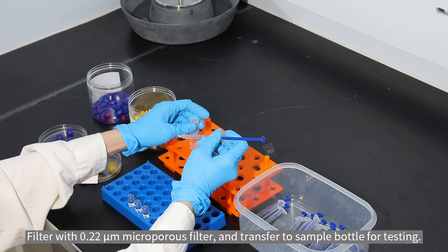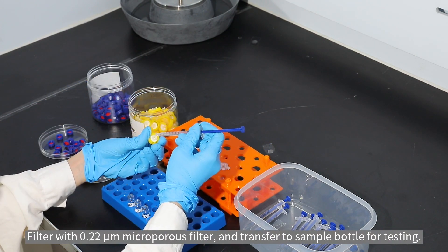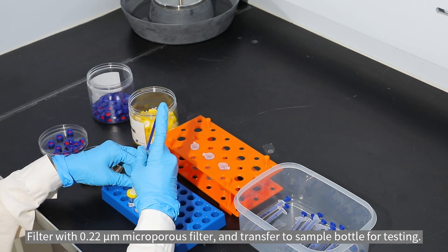Filter with 0.22 micrometer microporous filter and transfer to sample bottle for testing.